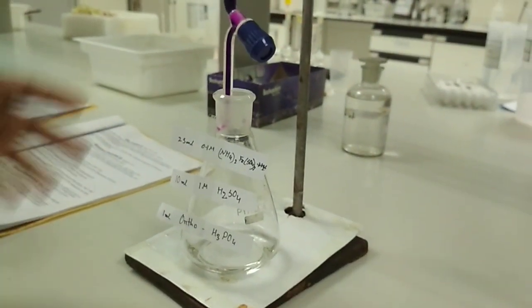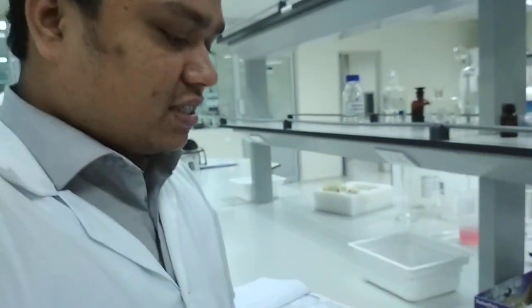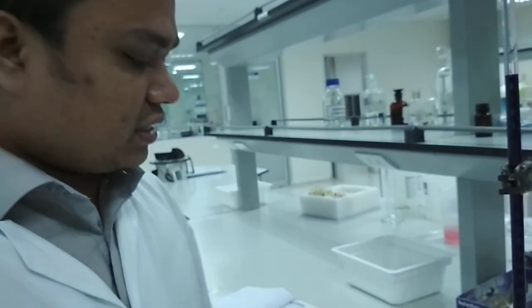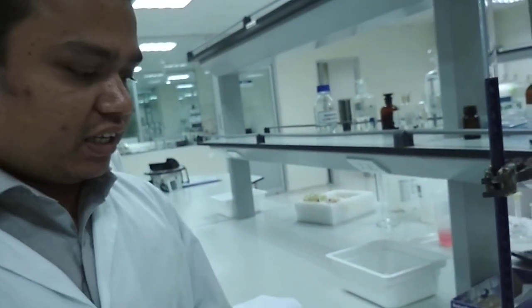Now we are going to see how to titrate the ammonium iron 2 sulfate solution with potassium permanganate. We will standardize it in the following manner, and after that we will calculate and find out the standard strength of ammonium iron 2 sulfate. I have to be clear about why we need to standardize a solution: there might be some errors while we make a solution, 5% error is acceptable, and we calculate the real strength of the solution we have made. So let's go to the video to see how to do it.